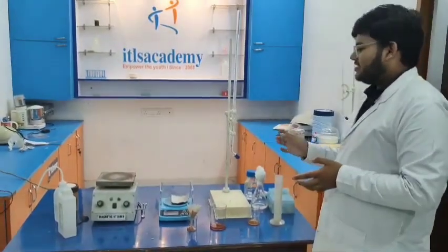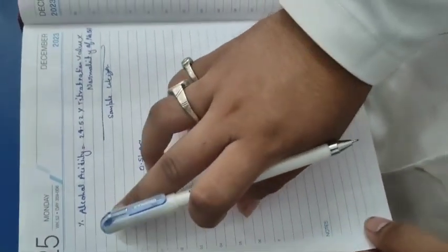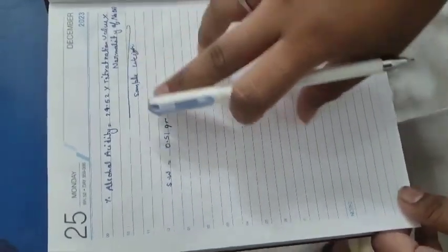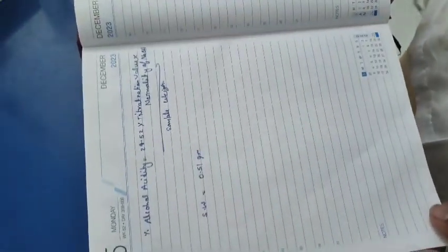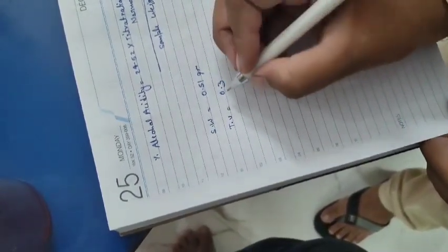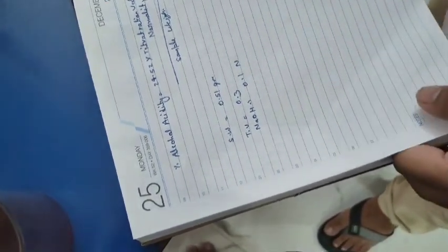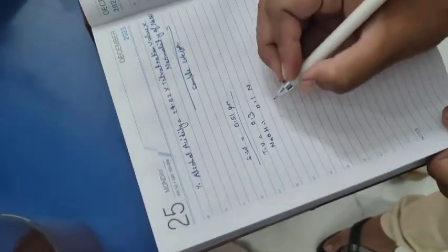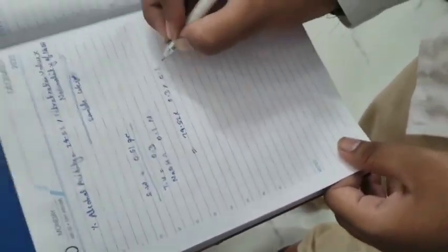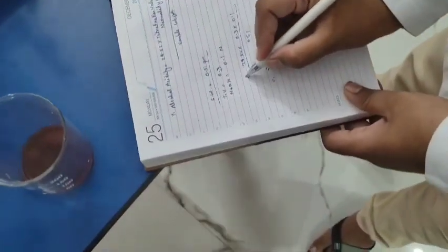Now calculate the alcoholic acidity using the formula: percentage alcoholic acidity = 24.52 × titration value × normality of NaOH ÷ sample weight. Here, the titration value (TV) = 0.3, normality of NaOH = 0.1 normal, and sample weight = 0.51 gram. So the calculation is: 24.52 × 0.3 × 0.1 ÷ 0.51.